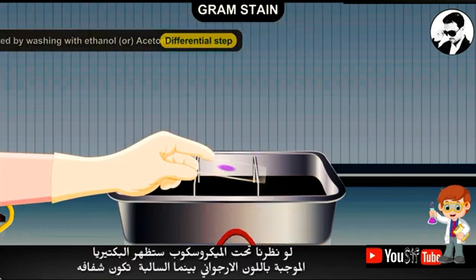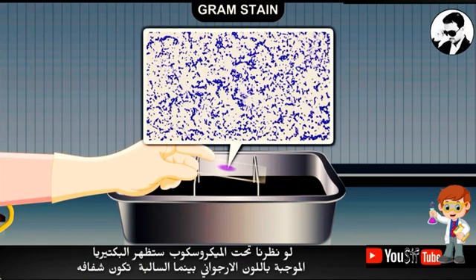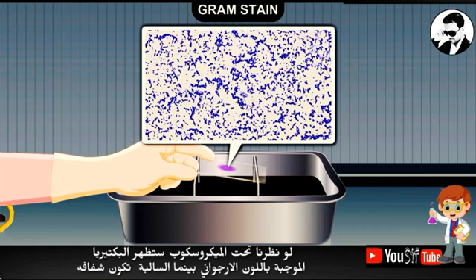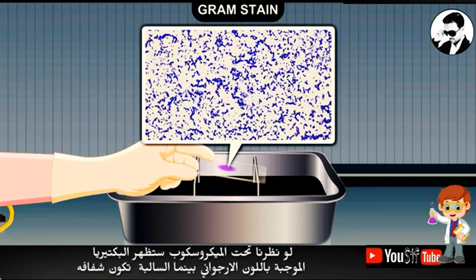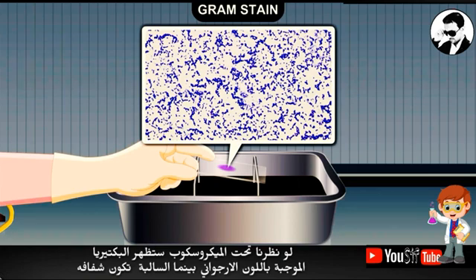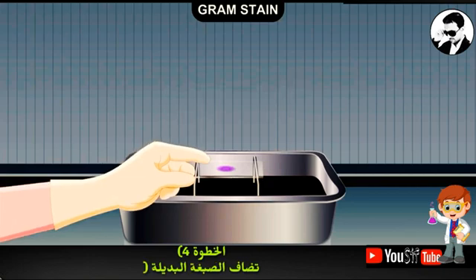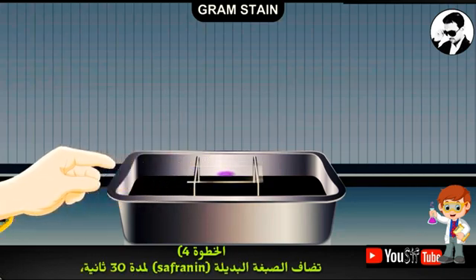Even gram-positive cells can lose the crystal violet-iodine complex during prolonged excessive decolorization. Excess ethanol is then washed off with water. When viewed under the microscope, gram-positive cells appear purple and gram-negative cells are colorless.